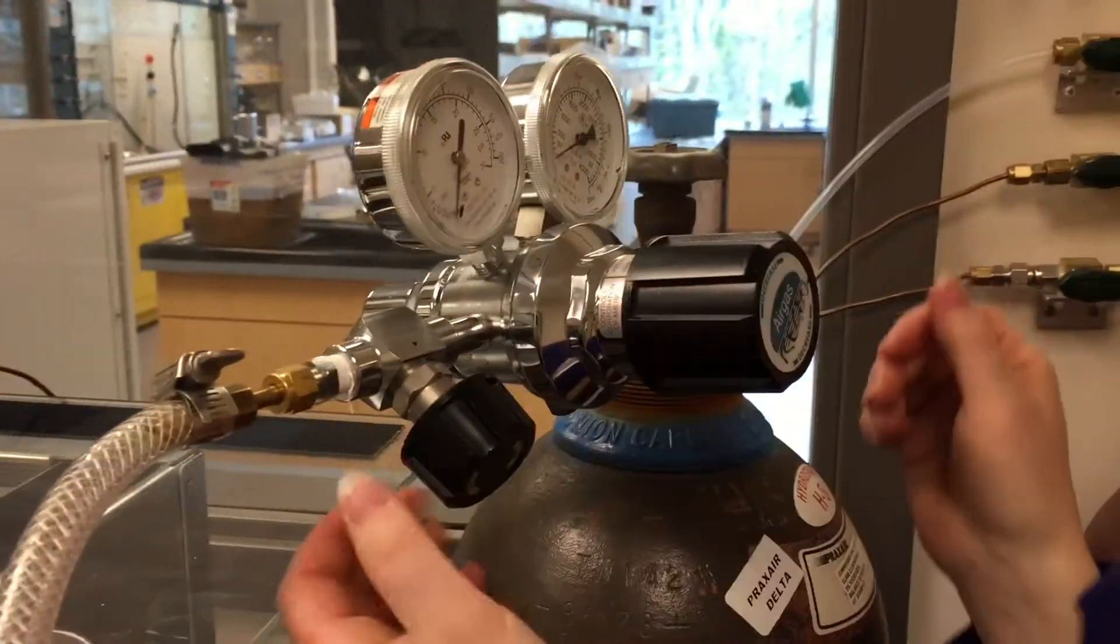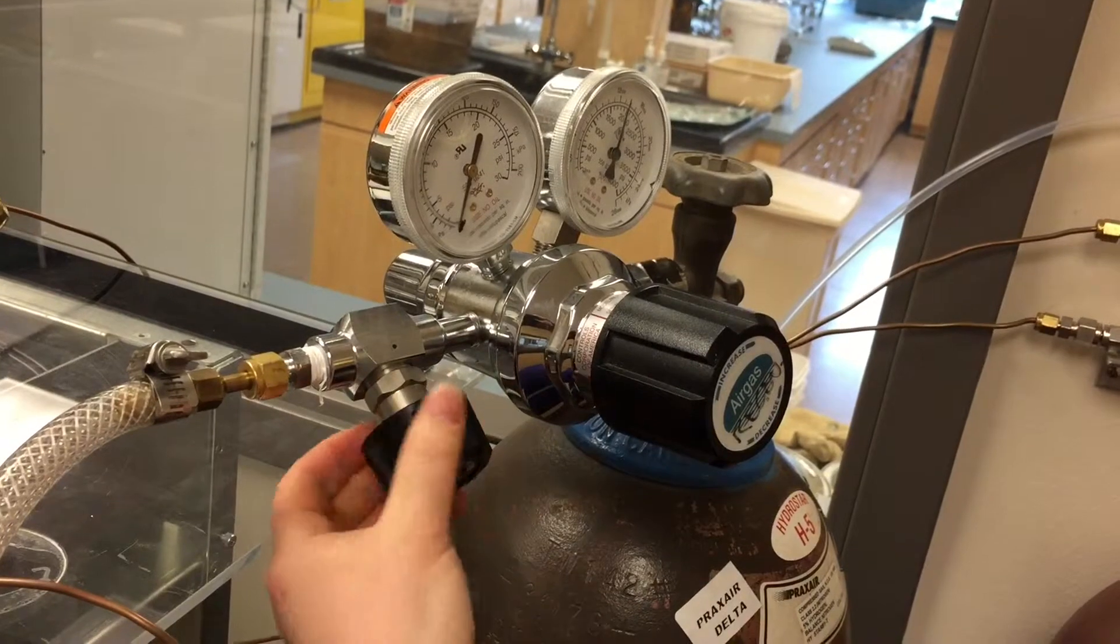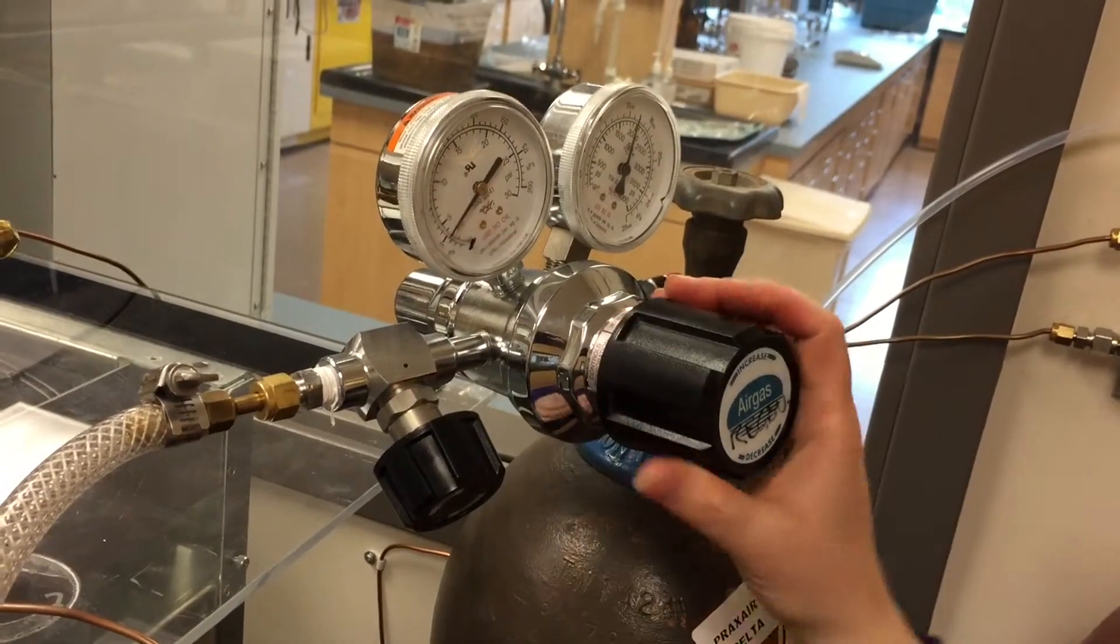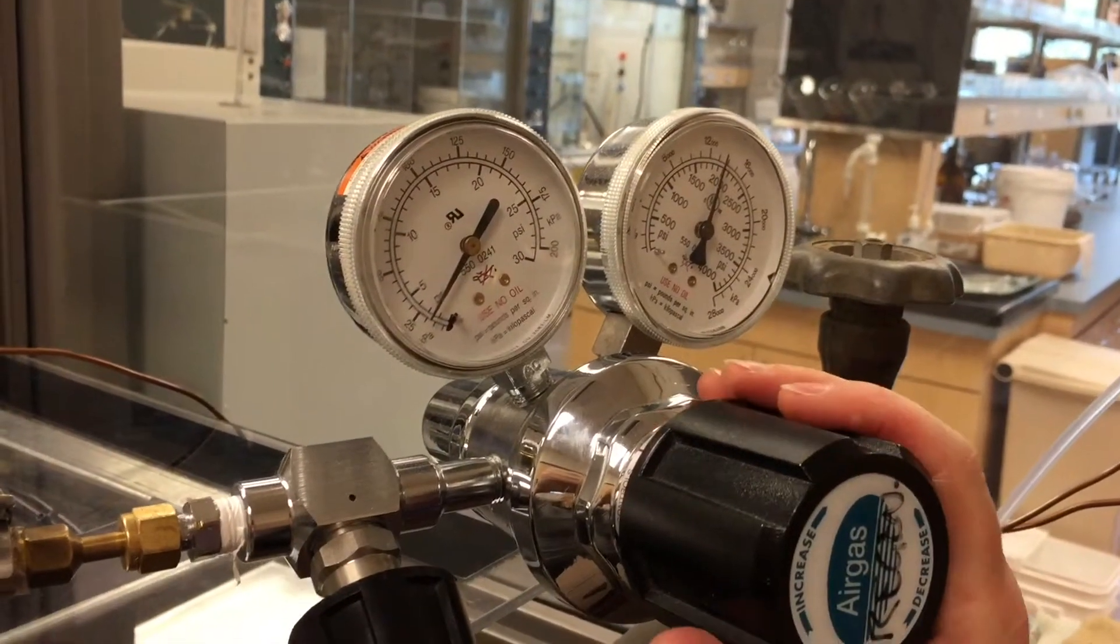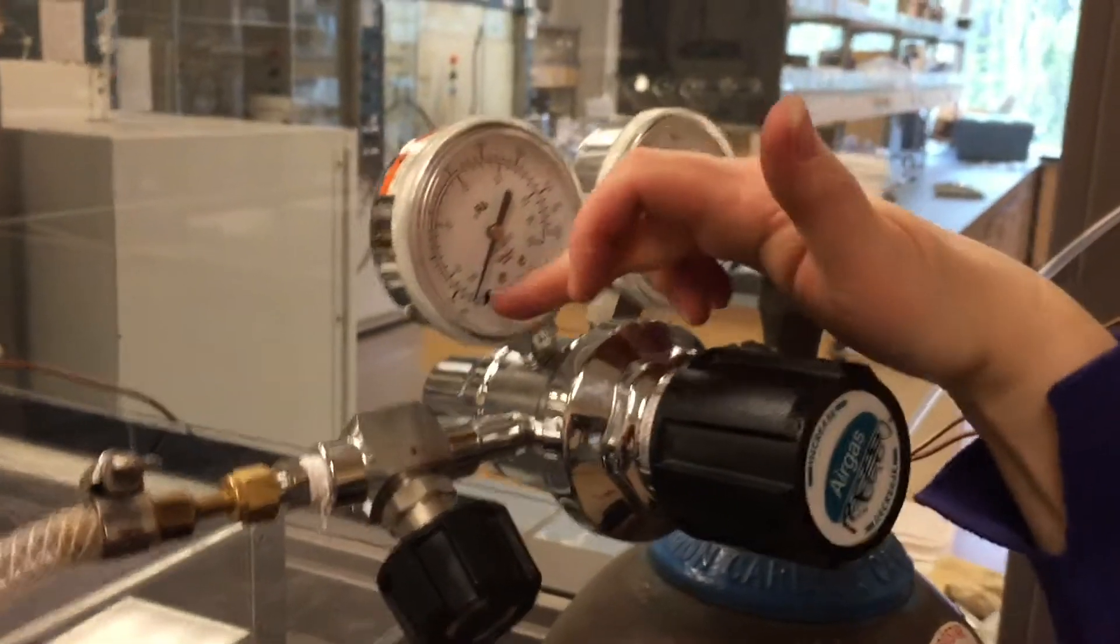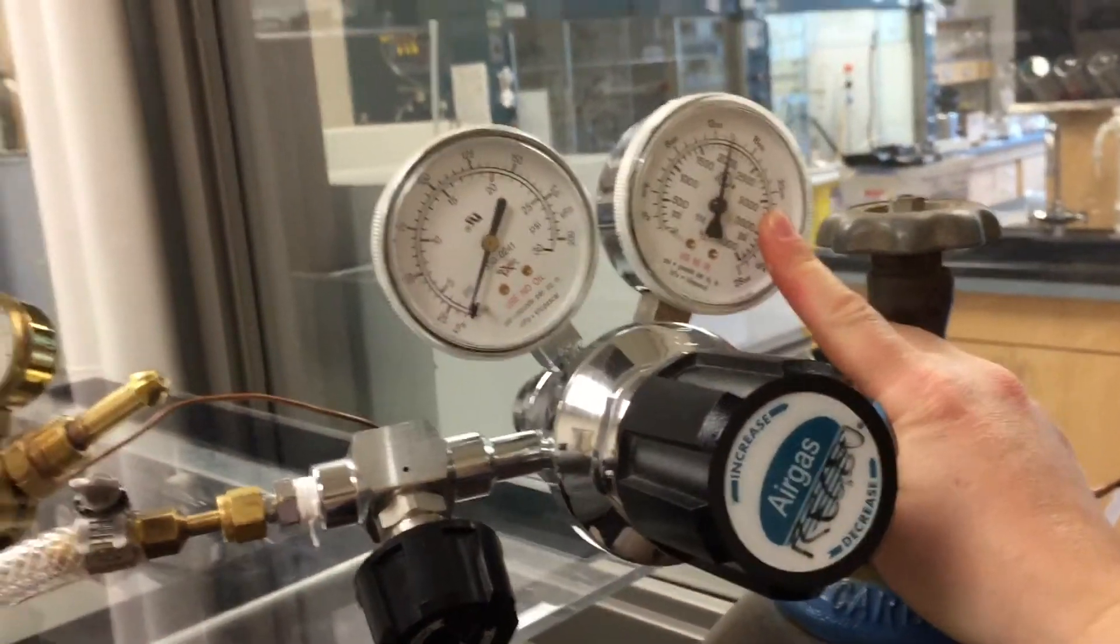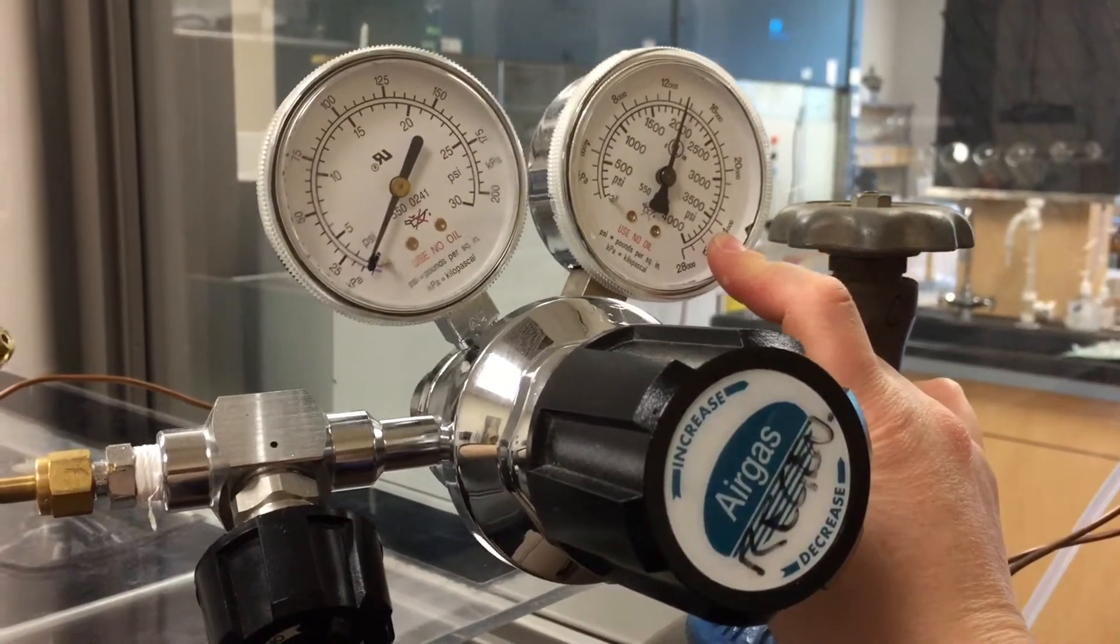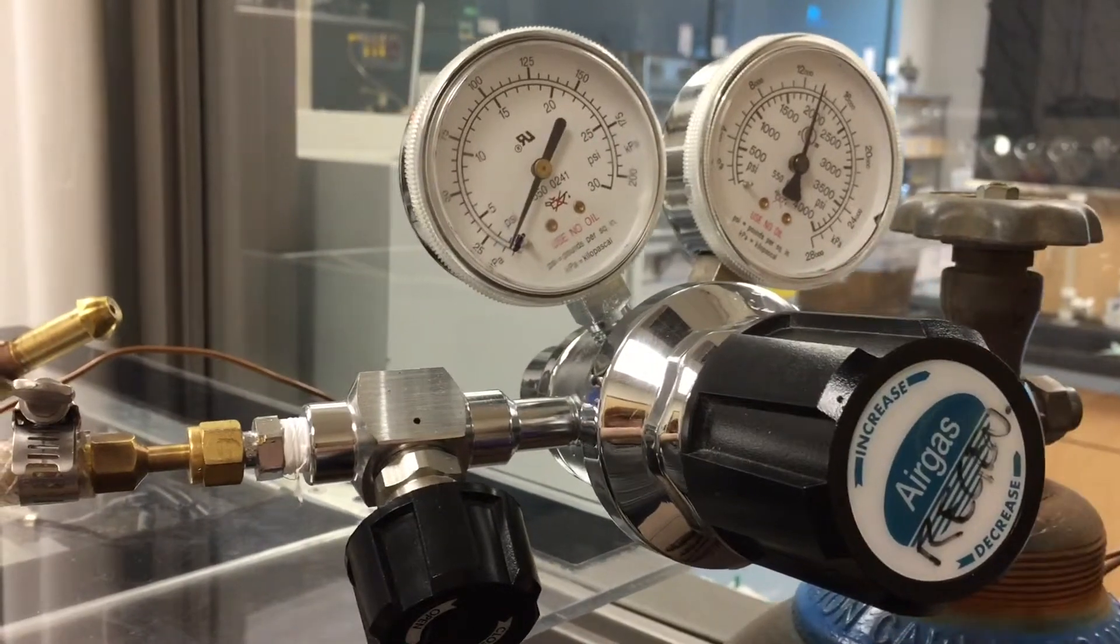We're going to open the valve, and then this one also. And then we're going to increase the pressure until it hits this mark here. That's why we have the mark on there. H5N gas. Just adjust the knob until it hits that mark. Now, you'll notice in this regulator, we've got about 2,000 PSI of H5N gas in here, which is plenty to regenerate the small glove box. We only need a maximum of about 1,100 PSI, so that will nicely regenerate the small glove box. If we're regenerating the large glove box, then we will need a full tank of H5N gas.